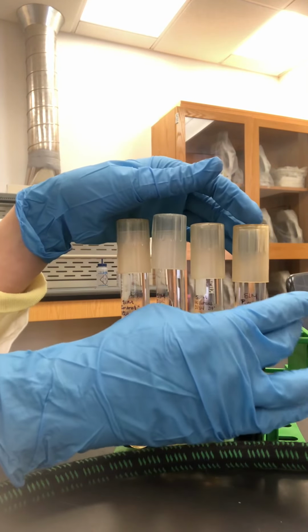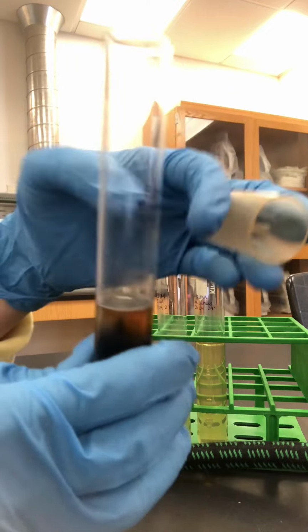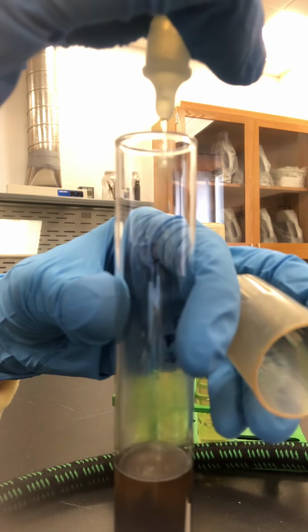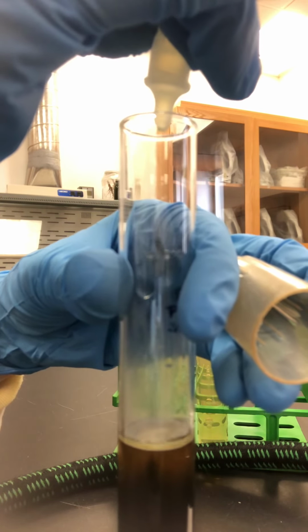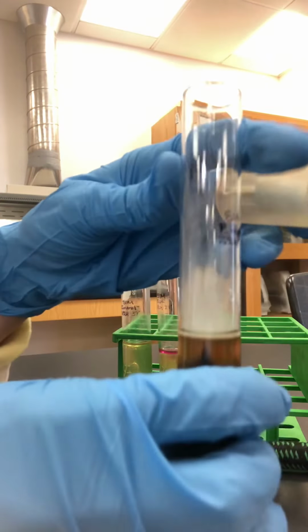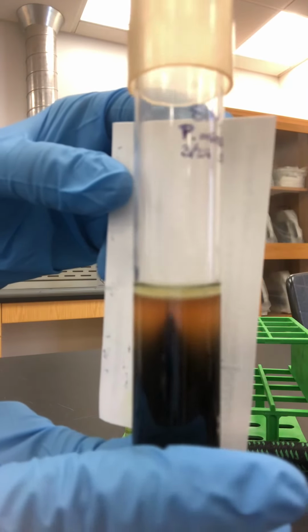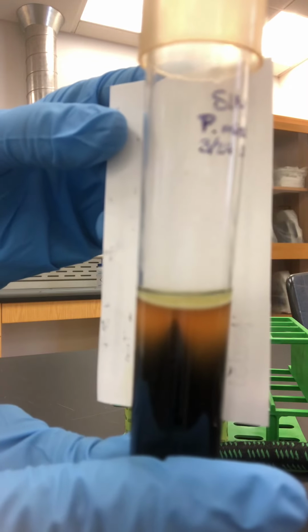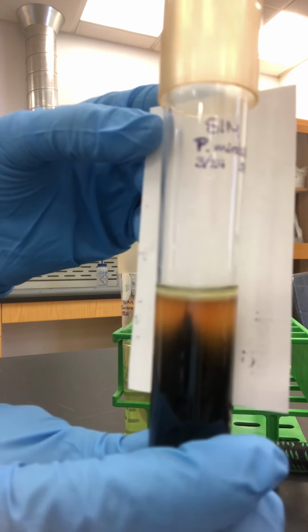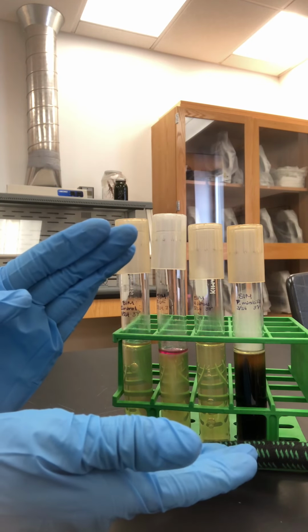And then our last organism, Proteus mirabilis, P. mirabilis. We'll test that for indole production with our Kovacs reagent. So we take our Kovacs just like before, drop it in. There we go. So that liquid on top there is yellow, not pink, for Proteus mirabilis. And that concludes your SIM test for 5-11.